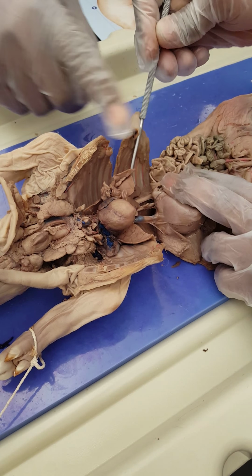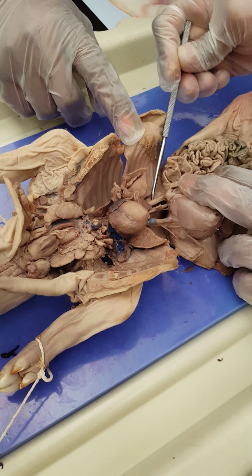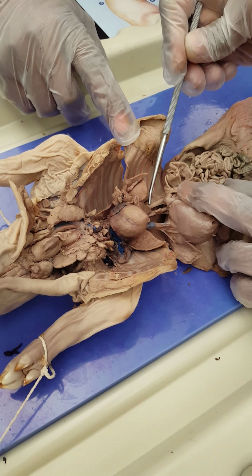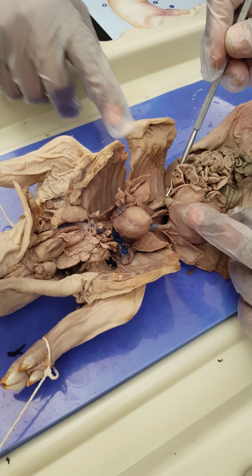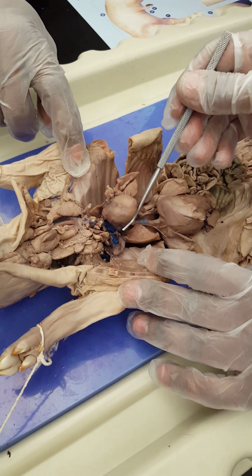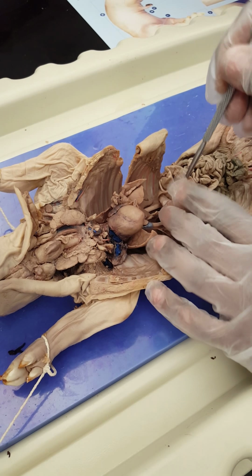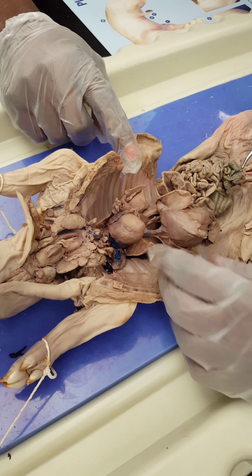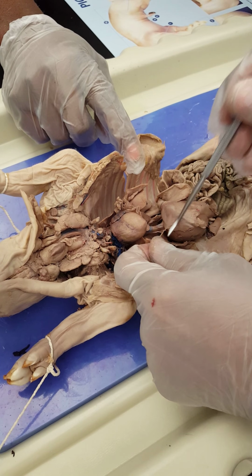If you see it from here, this is the abdominal aorta. Okay? Abdominal aorta. It's a little tough to see the thoracic aorta, so I'm not going to ask you about it. All right? If you know the abdominal aorta, should be fine. Okay? And this is the diaphragm.